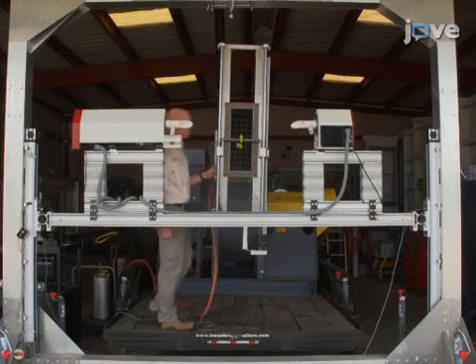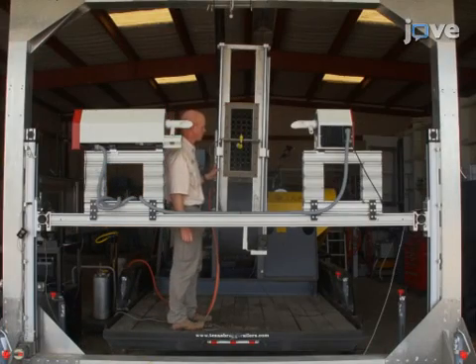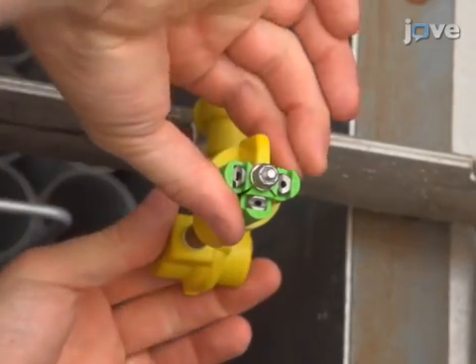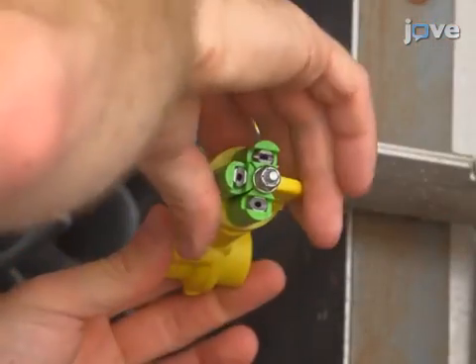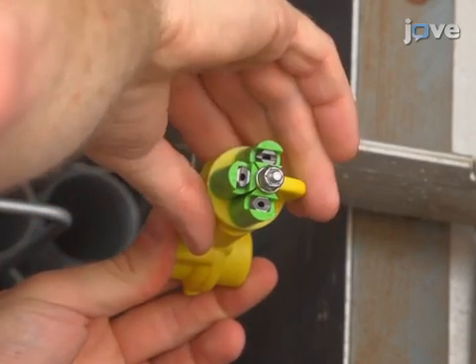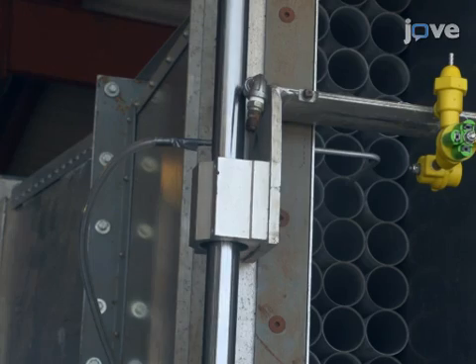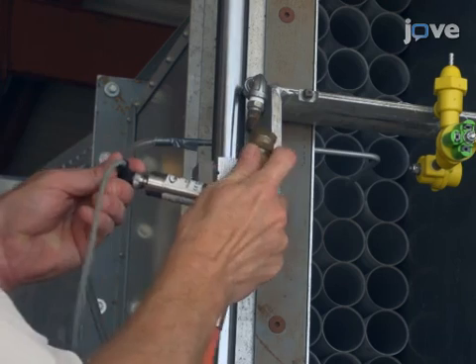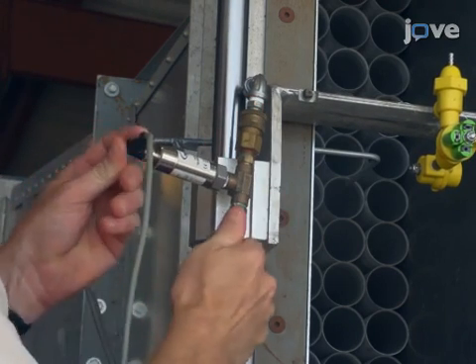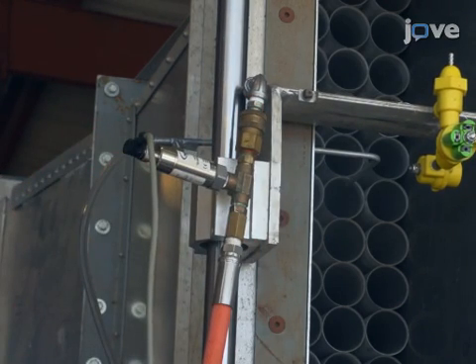Conduct aerial nozzle testing using a high-speed wind tunnel. On a boom traverse system in the airflow region, mount a nozzle body, nozzle, and pressure gauge. This test uses a standard 20-degree flat fan nozzle, oriented horizontally, parallel to the airstream.